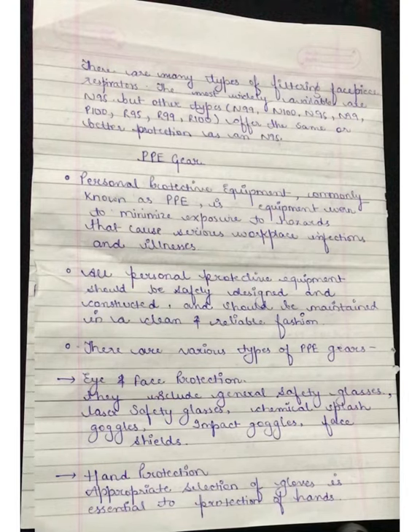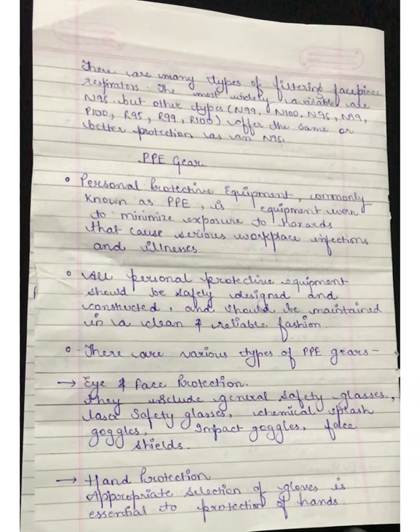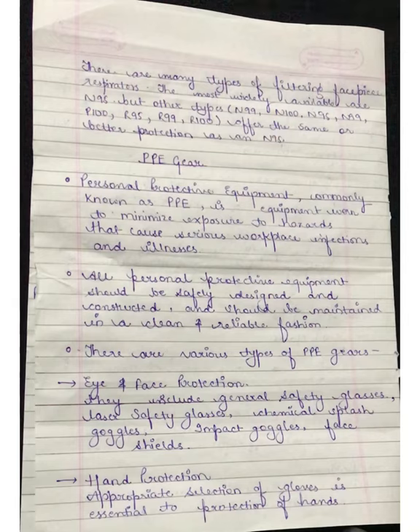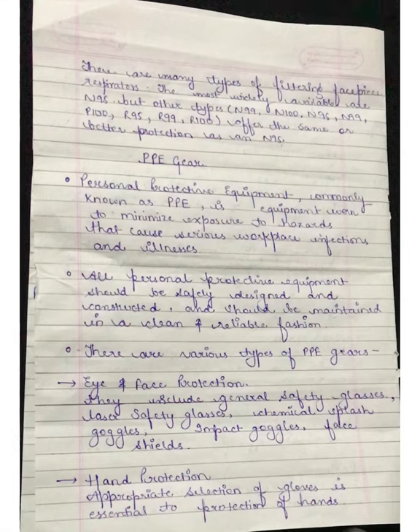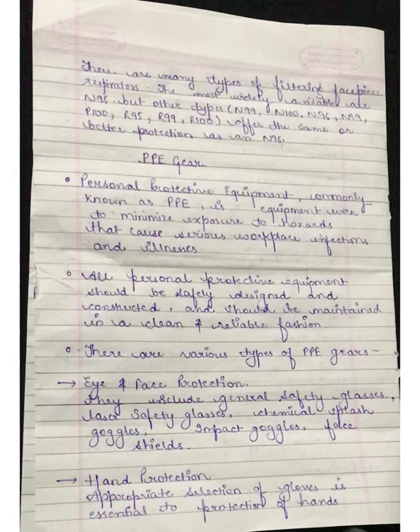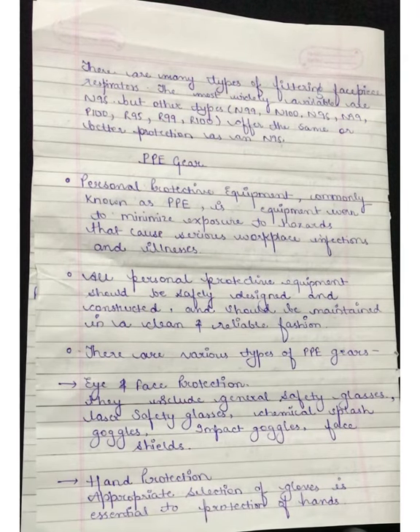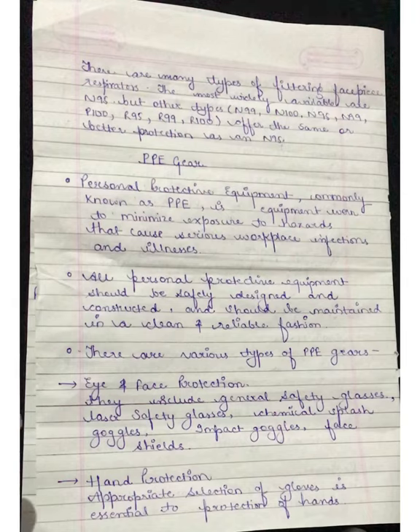Now let's see about the PPE gear. PPE stands for personal protective equipment. It is equipment worn to minimize exposure to hazards that cause serious workplace infections and illnesses. All personal protective equipment should be safely designed and constructed, and should be maintained in a clean and reliable fashion. There are various types of PPE gears.